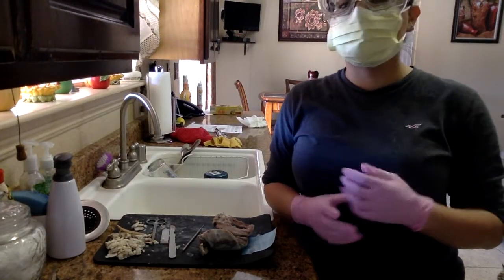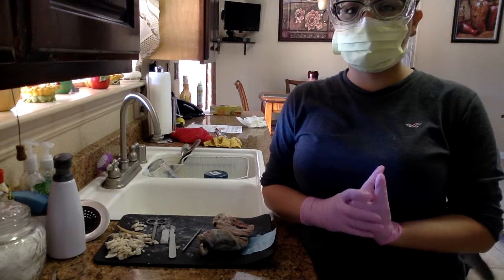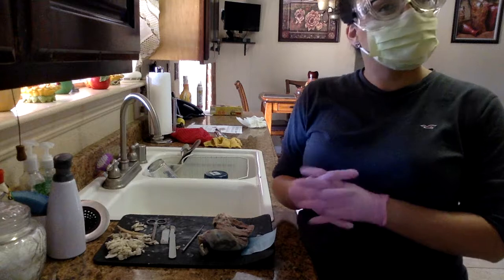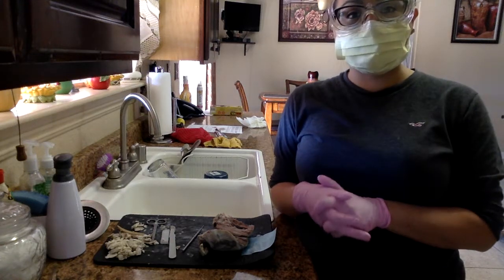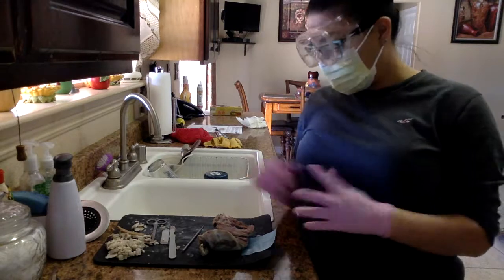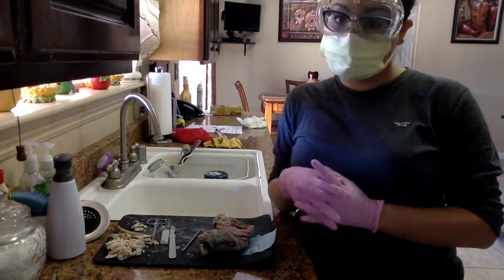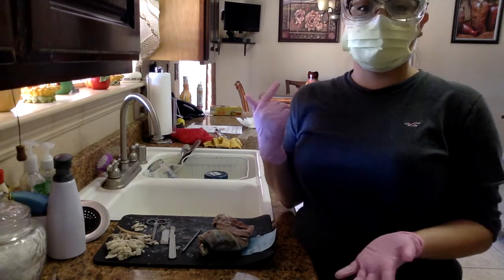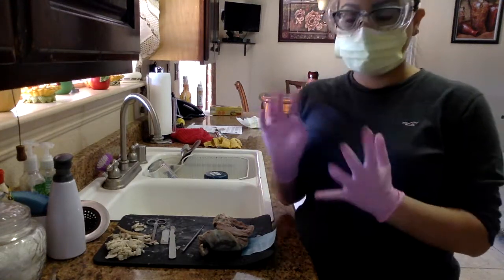This is week 2 of Anatomy Physiology Bio 240. Today we will be dissecting the sheep heart. The cardiovascular system is very complex. I've had fun digging into this. It was very hard, I'm not going to say it was easy. So let's get started. I'm going to identify for you 10 things.